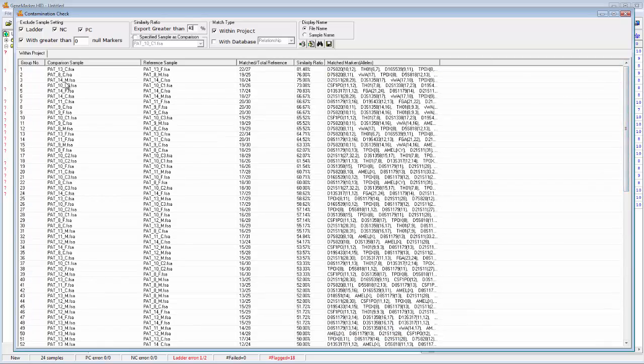And for each sample, I'm seeing the sample name, the reference sample, or the sample that it's being compared against, and then the matched number. This is the number of alleles that they have in common, the number of alleles the reference sample has, and then the similarity ratio. So you can see here the highest percentage I have is 81.48%. So that means that they share more than 4/5 of the same alleles. So that would obviously be an indicator of some kind of contamination.